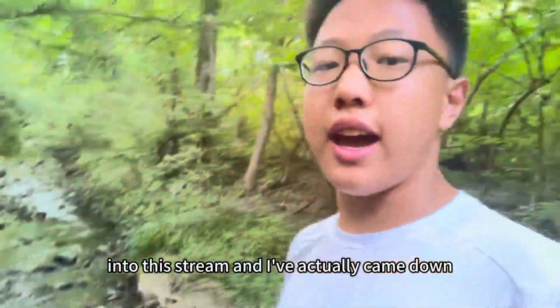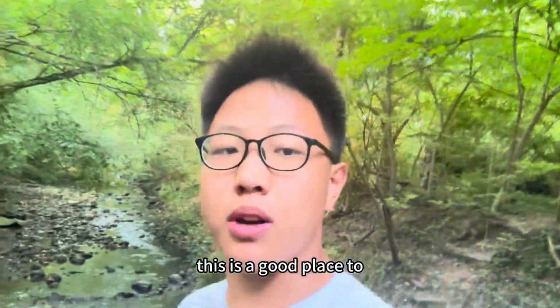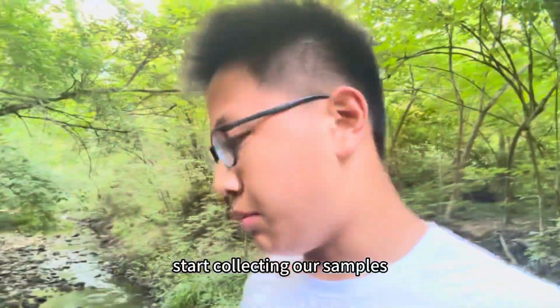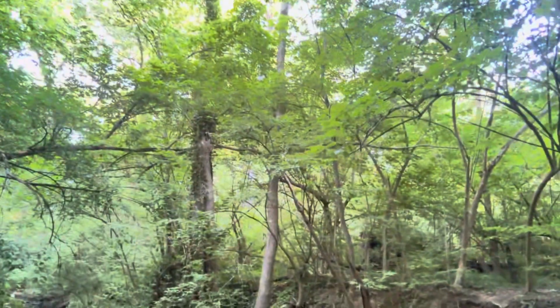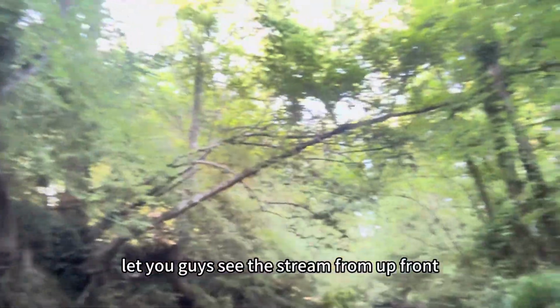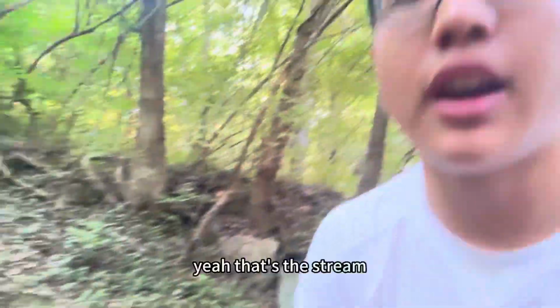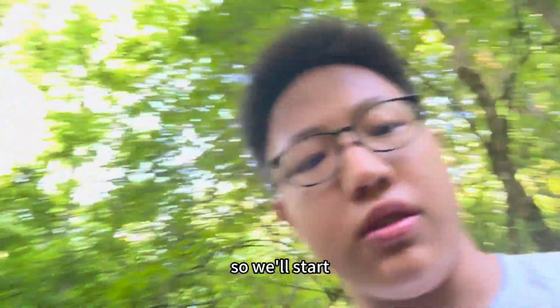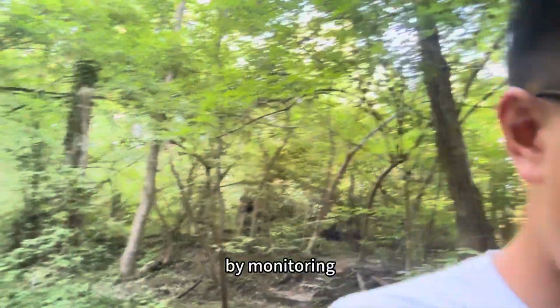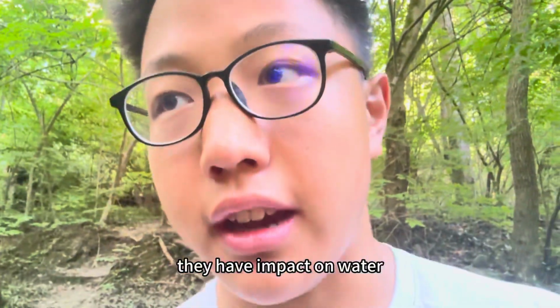I've come down to the stream where we have this current right here. This is a good place to start collecting our samples. And I can let you guys see the stream from up front. Yeah, that's the stream. So we'll start by monitoring the air temperature, because sometimes air temperature has an impact on water.